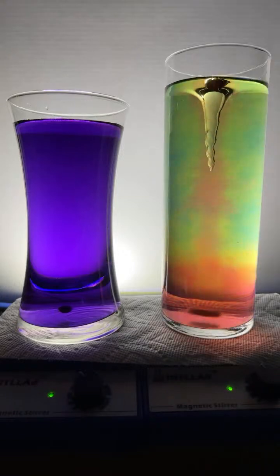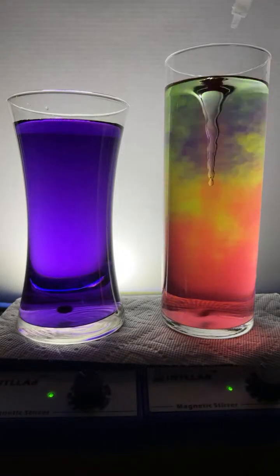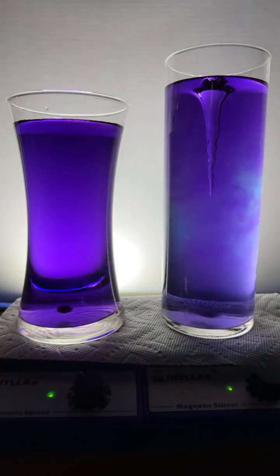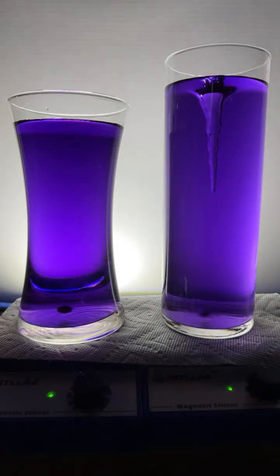That's correct, John Doe. Phenolphthalein is an indicator, and in fact, it is one of the indicators in universal indicator. Universal indicator is a mixture of 4 different indicators. Thank you there, Nut. Appreciate that.